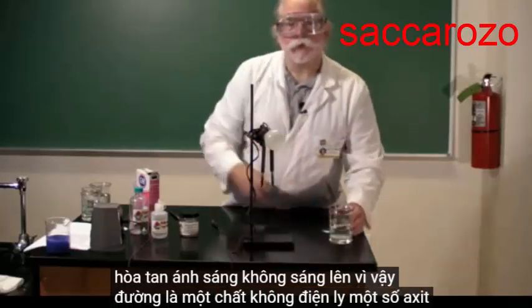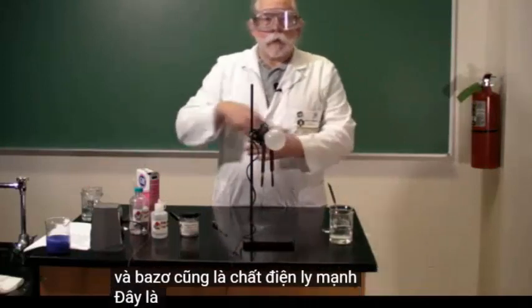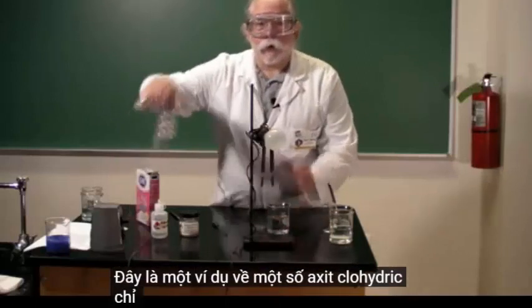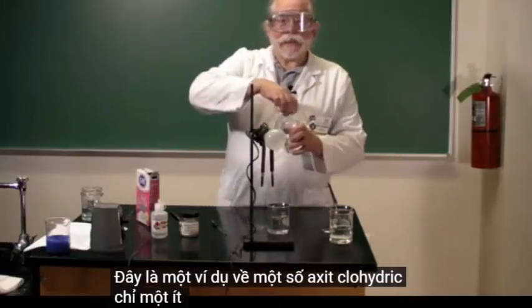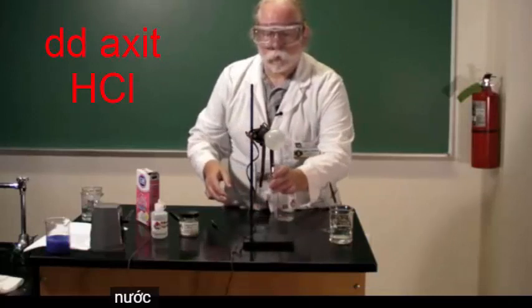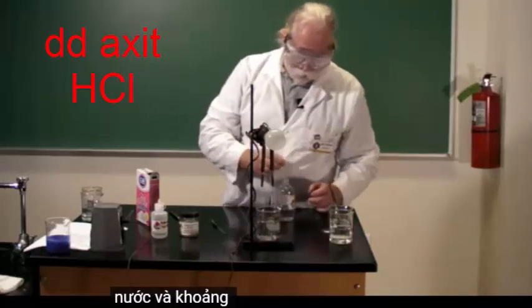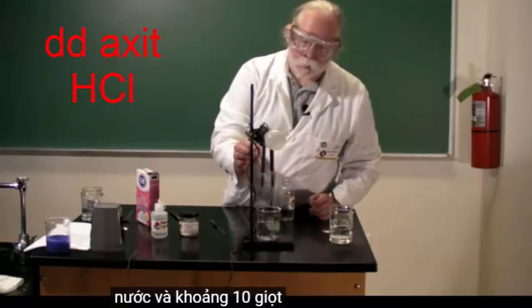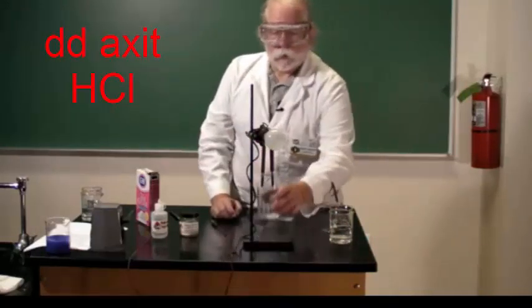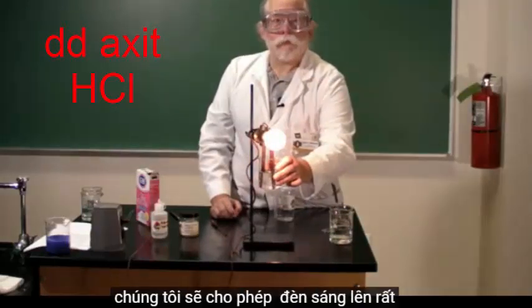Some acids and bases are also strong electrolytes. Here is an example of some hydrochloric acid — only a little bit in the water, about 10 drops — which will allow the light to light up very brightly.